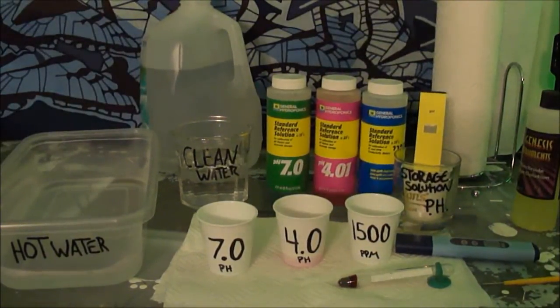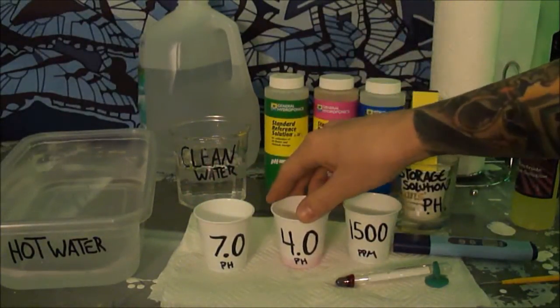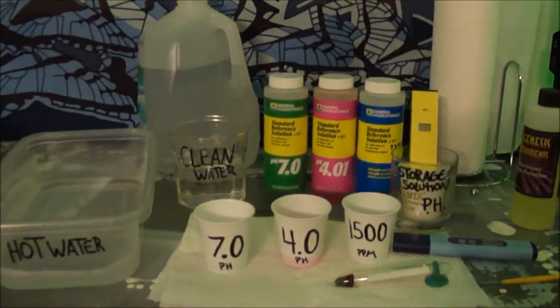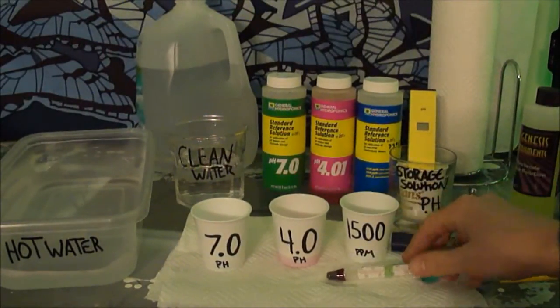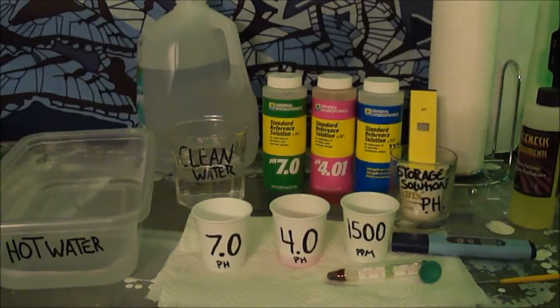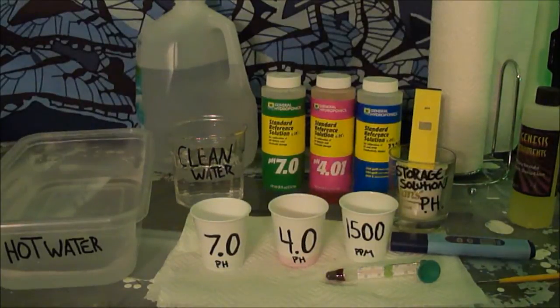The process is the exact same — you do the pH meter twice, at 4.0 and 7.0. The process is: dunk it in the water, pull it out around 74 degrees and it'll keep heating up, then stick it in the reference solution. You're supposed to leave it in there for a little bit longer, but this is just how I do it.